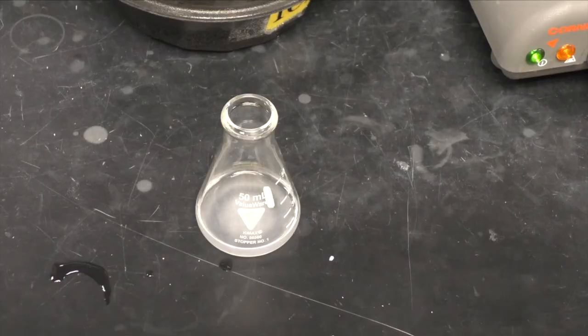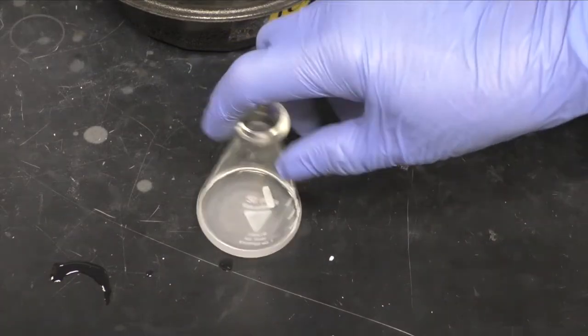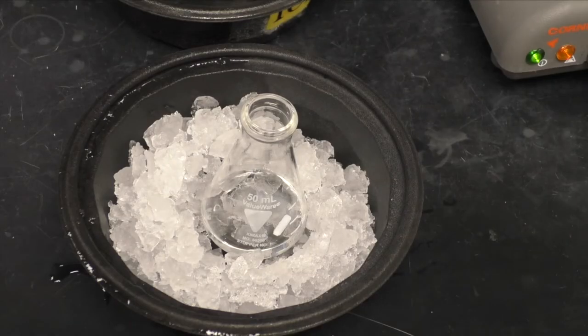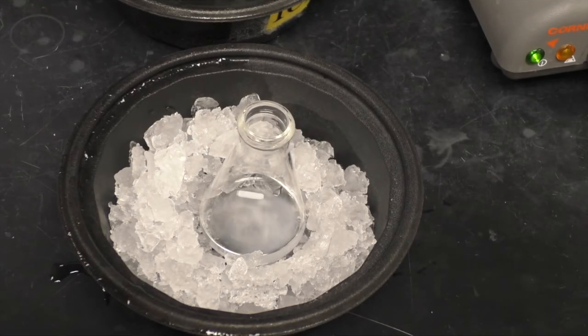Crystal formation will continue. Take this time to pre-weigh the filter paper and watch glass.